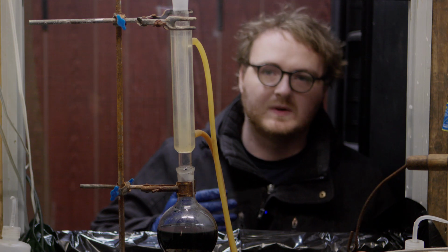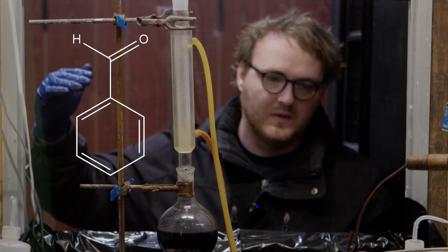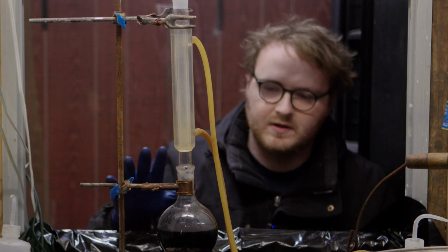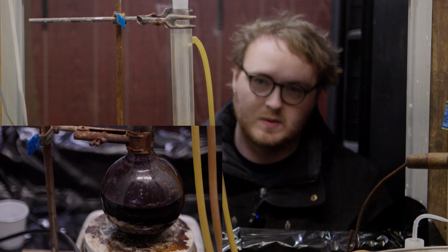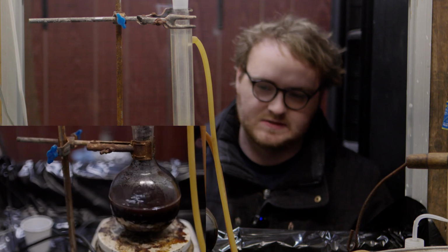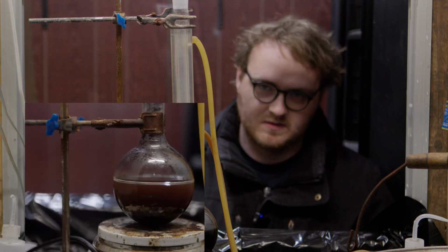So yeah, in principle, we are sort of oxidizing the toluene, sort of leveling it up to the level of a carboxylic acid, or in this case, benzoic acid. Now, an important thing to note in this reaction is that the toluene is in excess, which means that all of the potassium permanganate will sort of react away, and then it'll turn into solid manganese dioxide, which does not dissolve in water, and it'll just be sort of brown sediment that floats to the bottom.